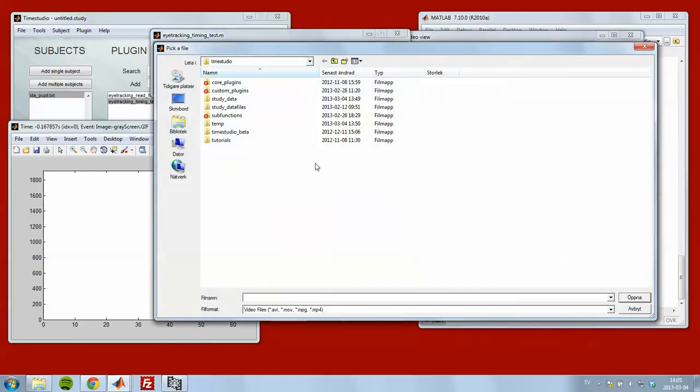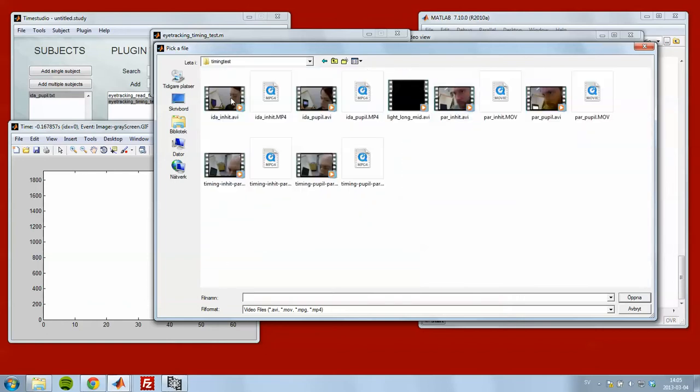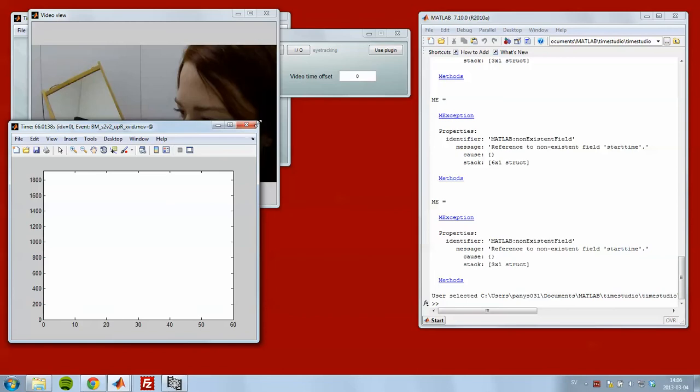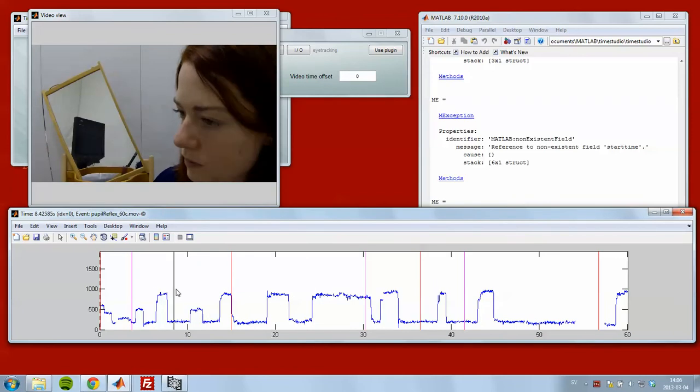It's possible to browse a video file, so I browse to the file that I just have data from. It's this one. And this window starts to initialize the video, which takes some time, unfortunately, but I think that's a matter with the codec or with MATLAB. Once it is done, okay, there we go, I can use the window down here as a timeline.